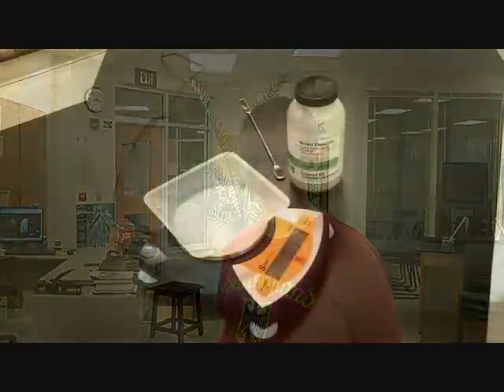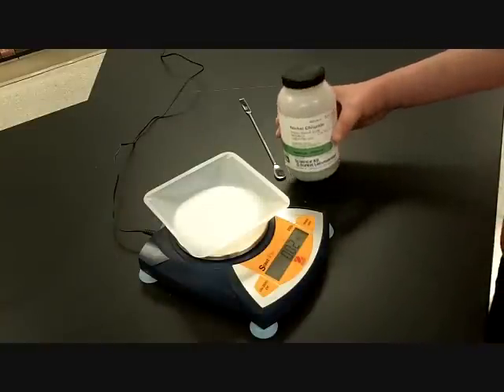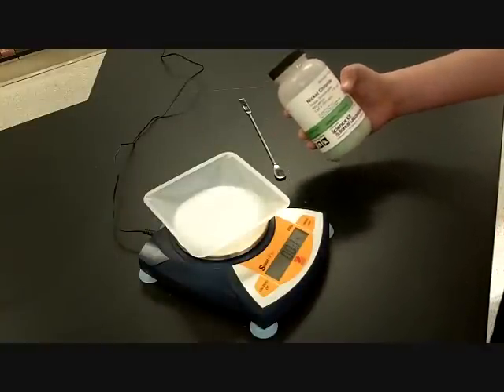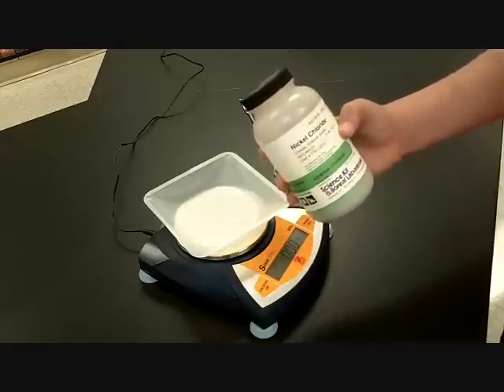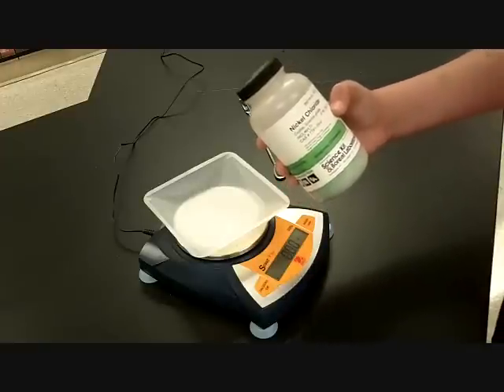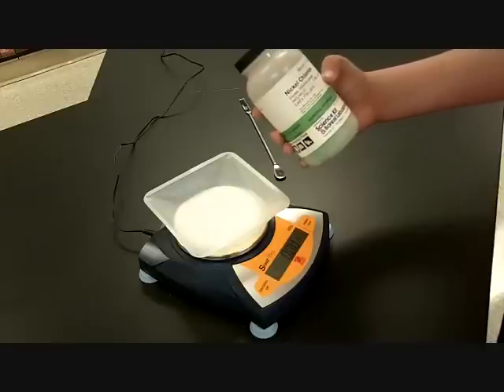All right, guys, Samuel is going to show us how to prepare this solution, the 500 milliliters of the 1.5 molar stock solution. Samuel, do you want to say hi? Sounds good. Let's get busy. So first, we take the nickel 2 chloride. Is that nickel 2 chloride, Sam? Yeah. Okay, bring it up a little closer to the camera. Perfect. Go ahead and measure out the 97.19 grams.